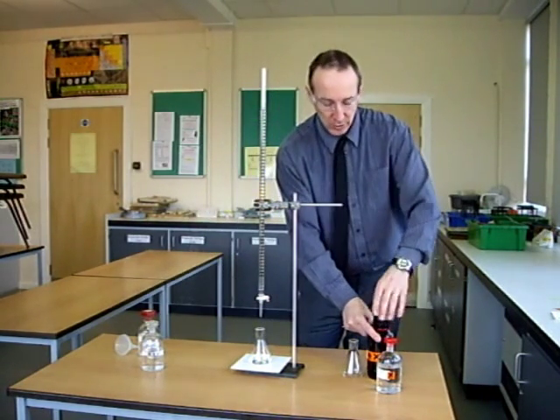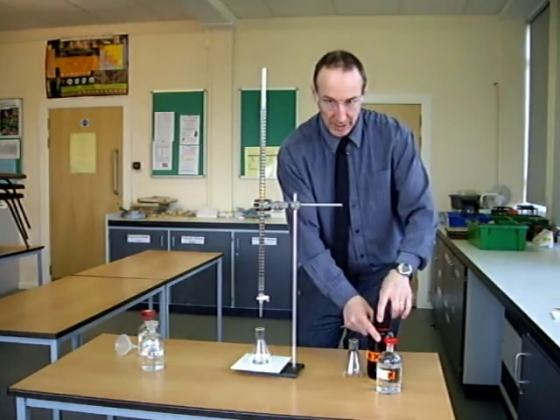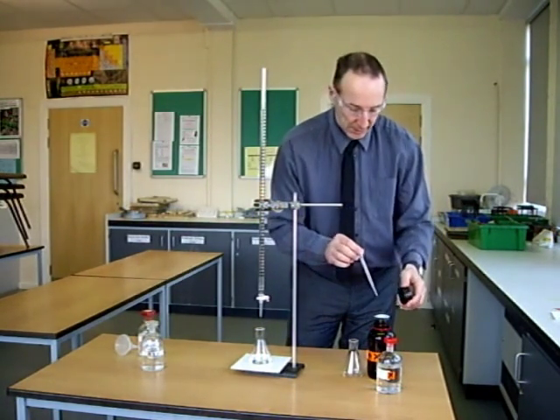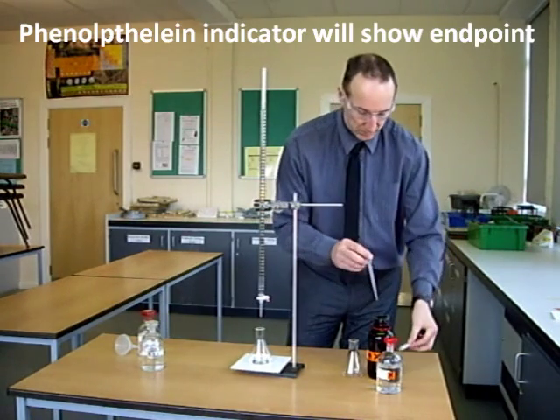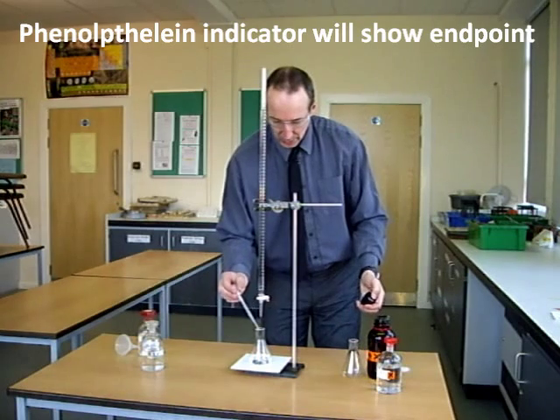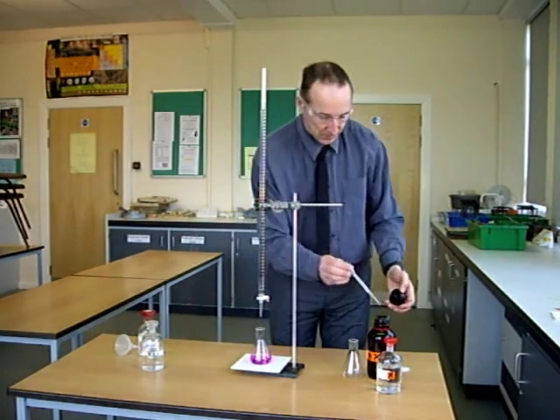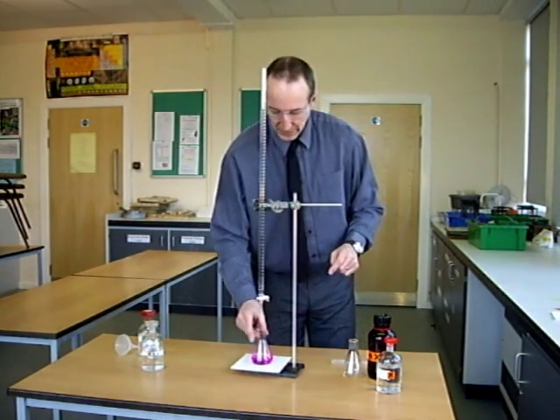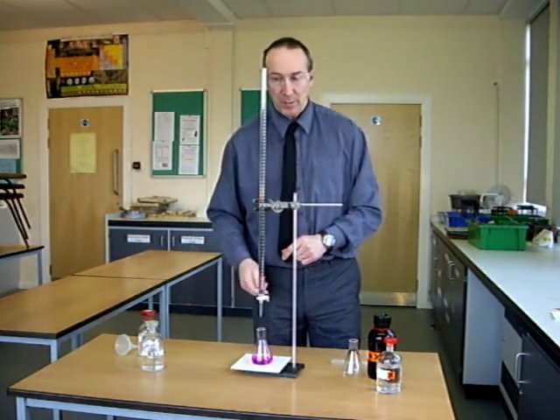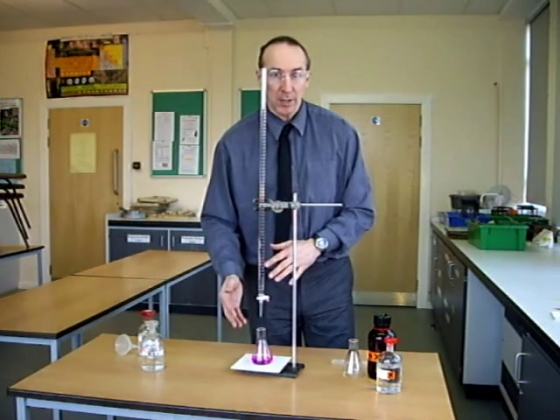To let me know when it's neutral, I'm going to use an indicator. In this example, I'm going to use phenolphthalein indicator. Just a couple of drops of that. Now, phenolphthalein indicator changes colour at the end point. It will go from pink to colourless.